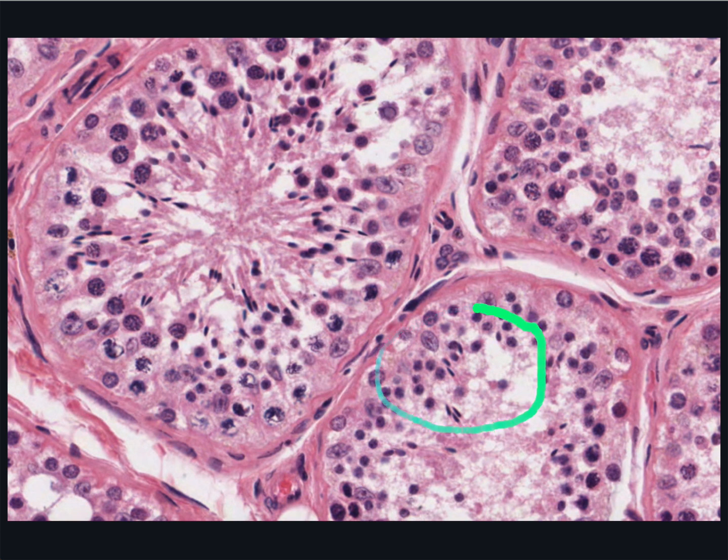First, identify Sertoli cells. You can recognise them by their relative pale staining, large, irregular shaped nuclei, although many are pyramidal, and prominent nucleoli. They tend to lie against the outer wall of the seminiferous tubule. Their lateral boundaries will be difficult to trace because their cytoplasm actually envelops all the neighbouring developing spermatogenic cells.